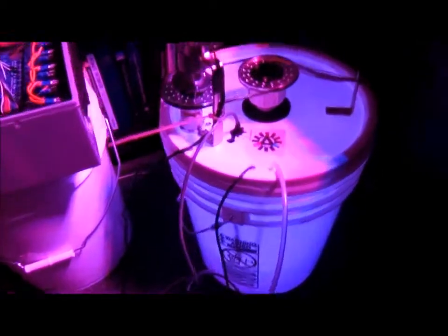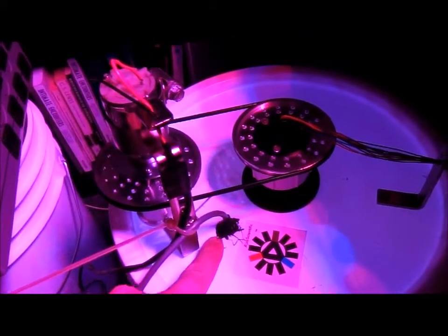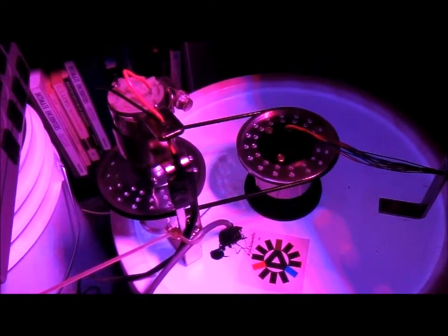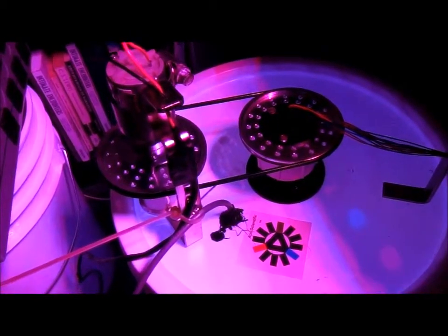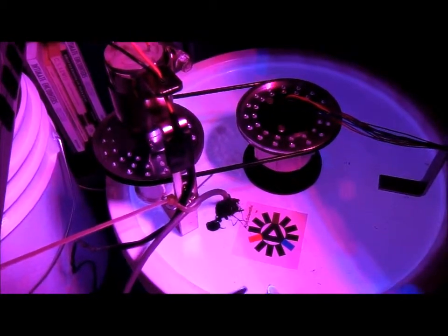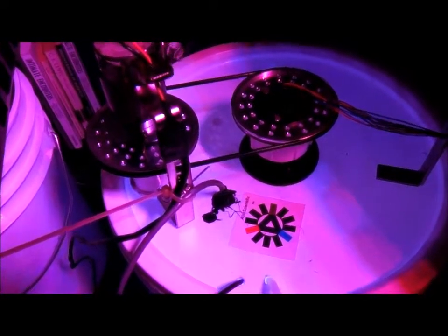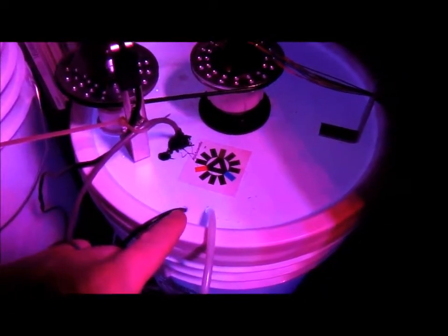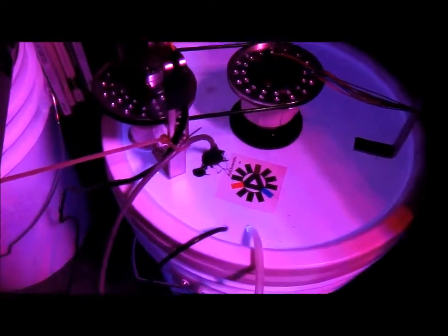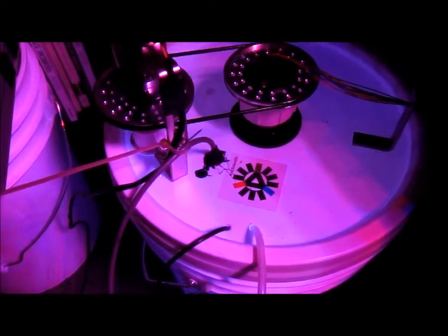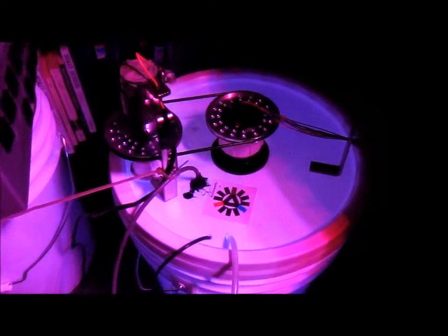So that's a major step forward. I still have to program the color sensor, which is right there. The color sensor will be used to determine how quickly and if the algae is ready to be harvested. And then I have a temperature sensor right here that also has to get wired in to the system through the RJ-11 system.